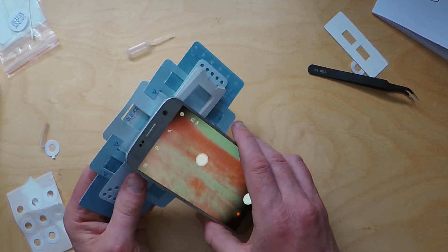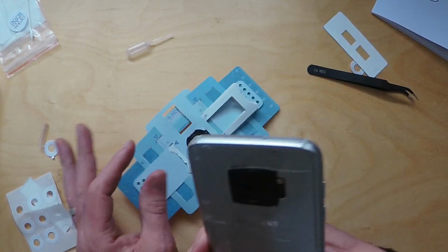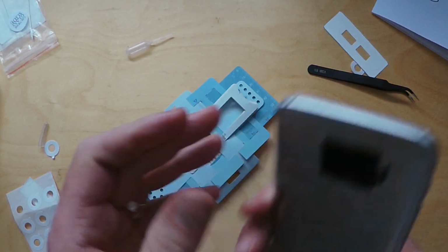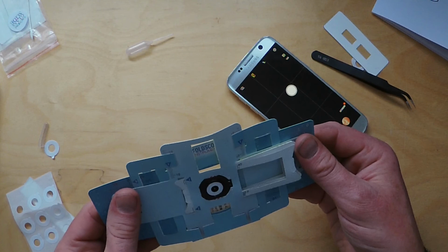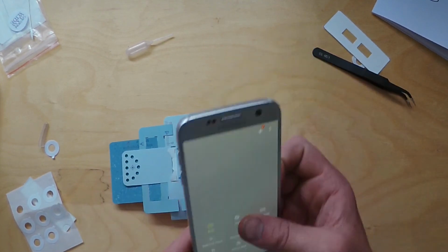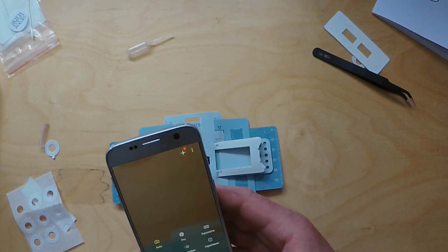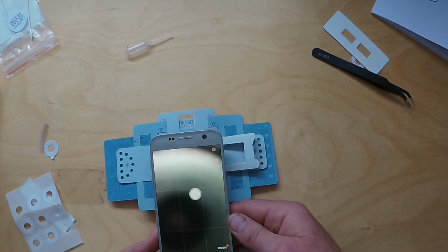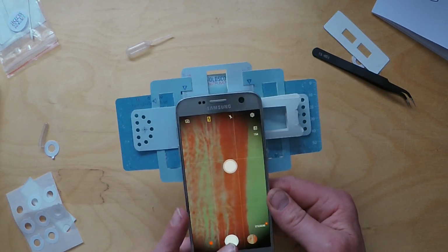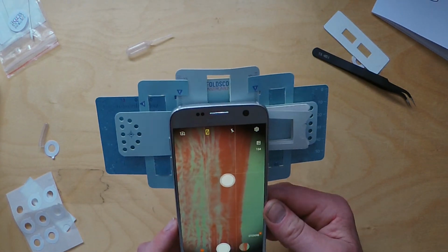So when it comes off, slide it off, make sure it sticks again. Maybe adjust your slide to a different position, and again let that jump on. There's your image.